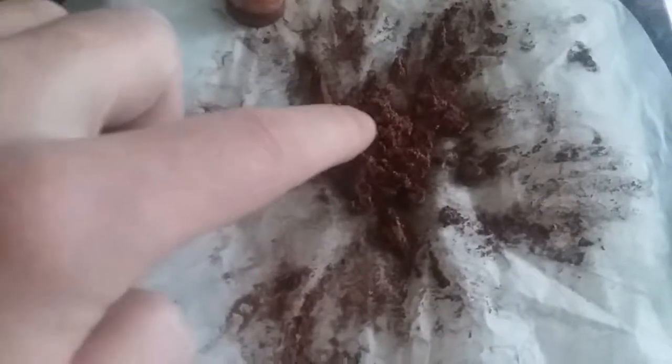This is the copper that was left in the bottom. Not really much crystalline structure there. It's very fine — pretty much dust, which is pretty cool in its own right. Not what I was going for, but I think if I dry that out and put it in little bottles it could look pretty cool.